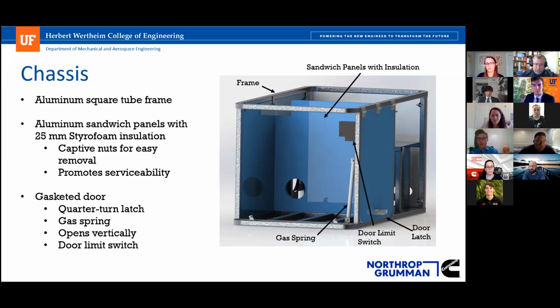So also fit and finish of the product, we felt that aluminum box tubing was going to be the better way to go there. The actual bodywork of it is made of sandwich panels that have a thin wall aluminum sheet and styrofoam insulation. Calculating the insulation thickness, we back sized the aluminum tubing size so that they were all flush mounted. So the box tubing and the panels are the same thickness, so it's nice and flush there. The panels are held on by 1/4-20 fasteners that have captive nuts on the backside that are welded to the frame, so it's easy to assemble. There's only 3 bolts that hold each of the panels in.